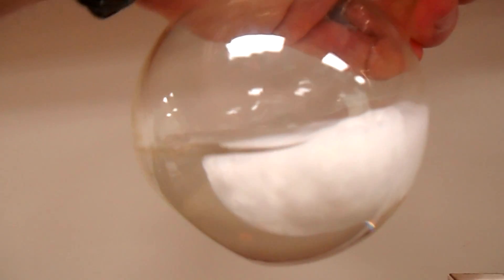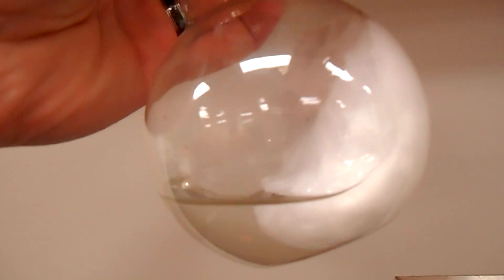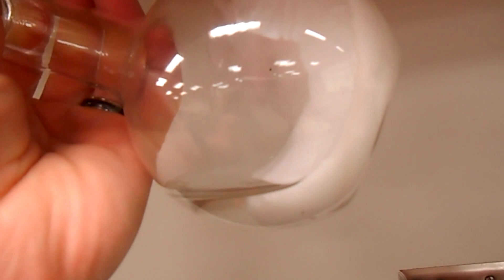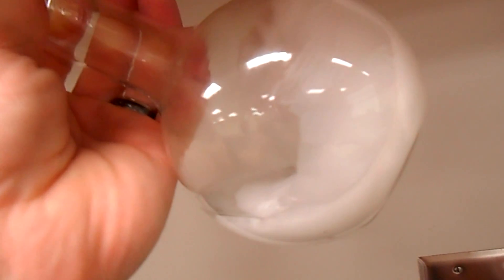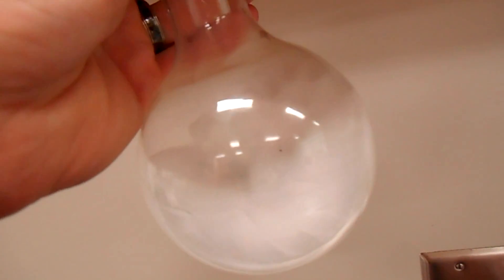It looks as if the solution is freezing, and in fact some videos out there on the internet call this hot ice. But the solution is not freezing — instead, what's occurring is the solute that was dissolved in there is precipitating out, growing off of that crystal. It's called hot ice because it does release some heat when this happens.